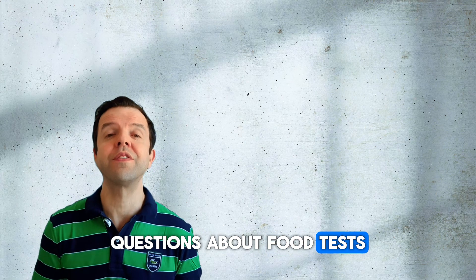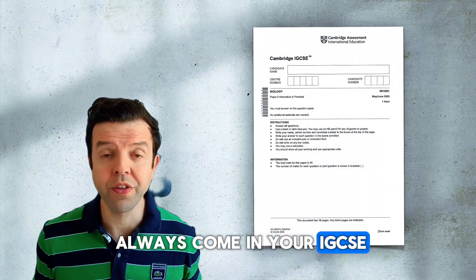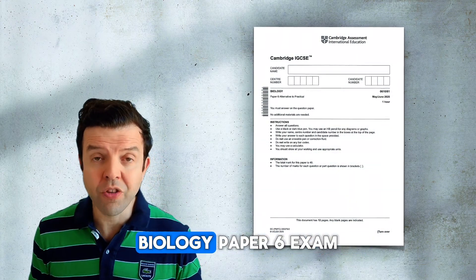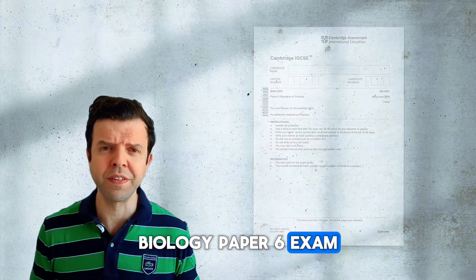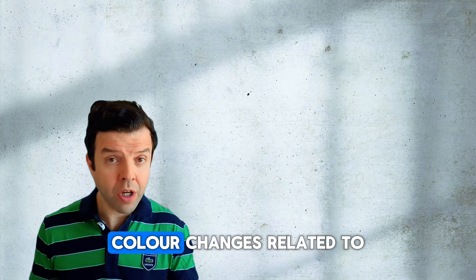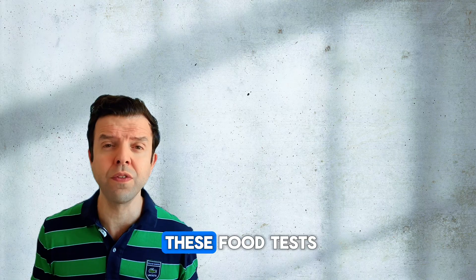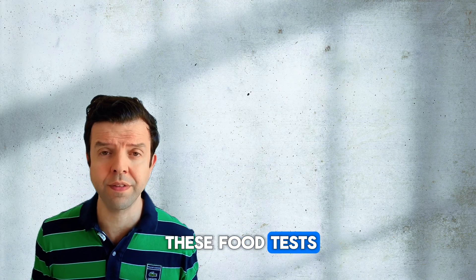Questions about food tests always come in your IGCSE Biology Paper 6 exam. Today I'm going to show you all the details and color changes related to these food tests.